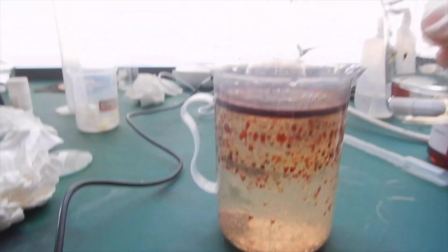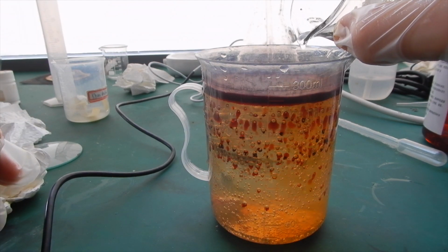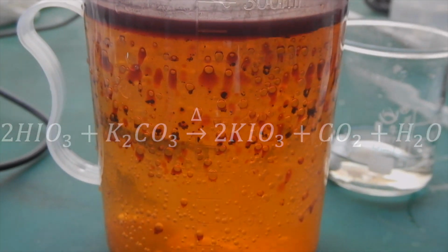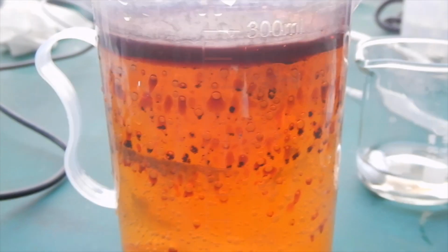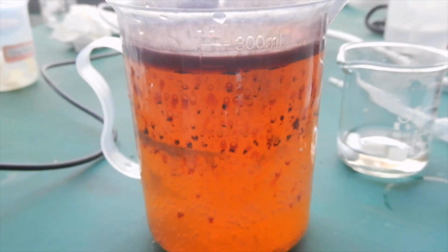Next, add the potassium carbonate solution into the large beaker slowly. A lot of bubbles form. The potassium carbonate reacts with the iodic acid in solution to produce potassium iodate and carbon dioxide. In a closer shot, you can clearly see the bubbles forming on the surface.